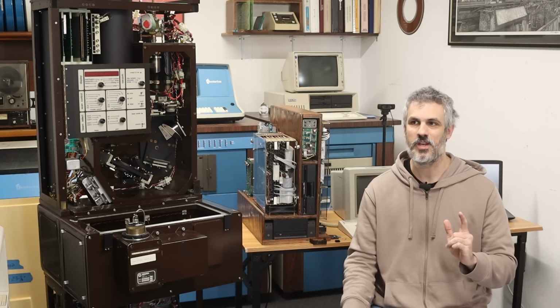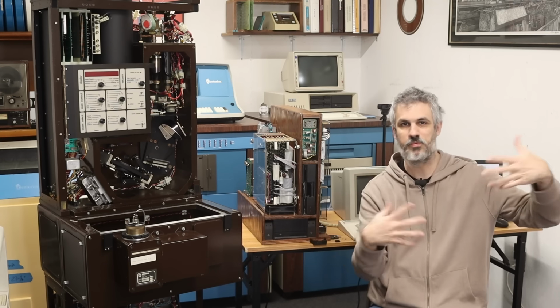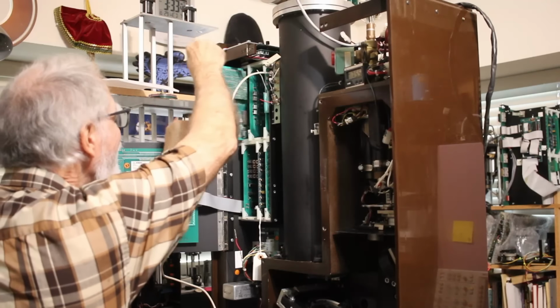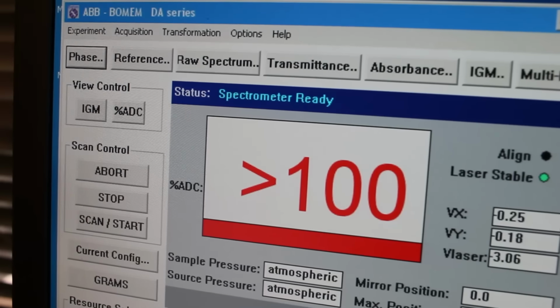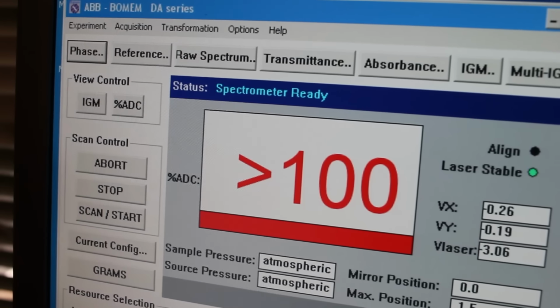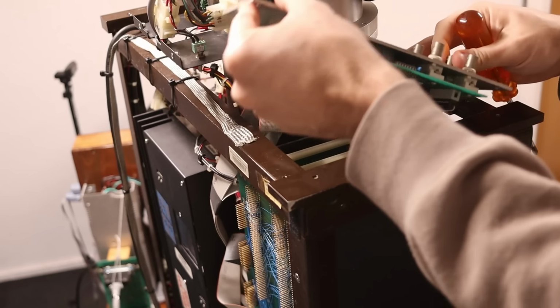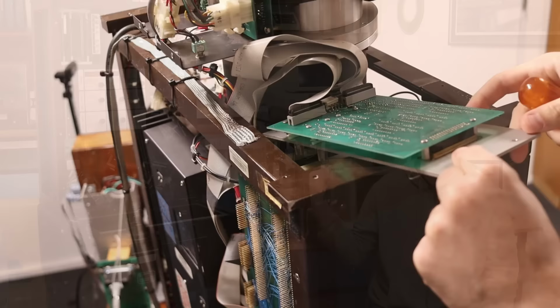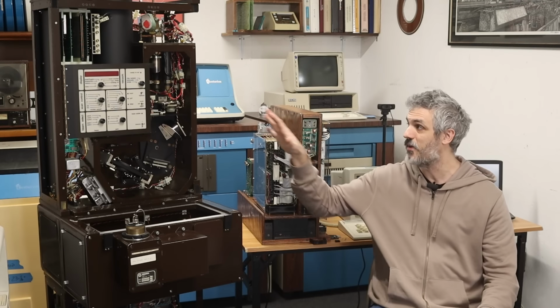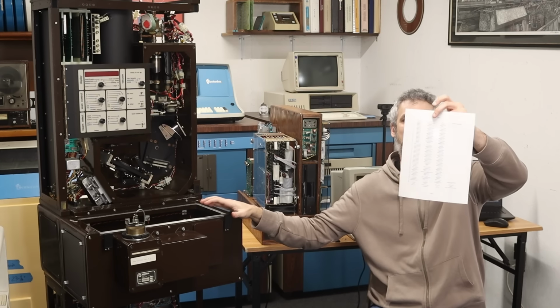And so what's going on here is that our two opto-isolator boards are different, wrong revisions. Now, keep in mind that this Bomem is incredibly powerful and it's been used throughout several decades, but the computers often got upgraded. So I think what's going on is I've got an opto-isolator board for a newer system than a PDP-11/73. And we dug through the schematics. We don't have schematics for any PDP-11 related stuff, but we do have schematics for almost everything related to the Bomem DA-3 itself. And I came up with this list right here.